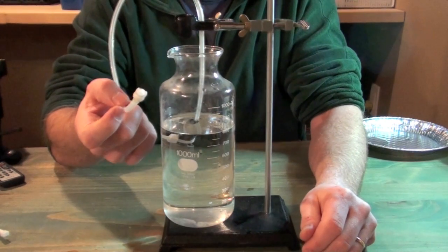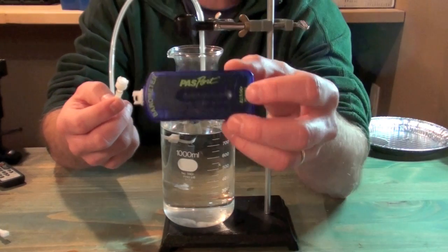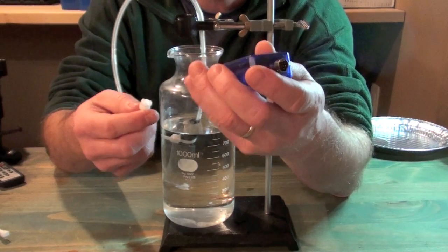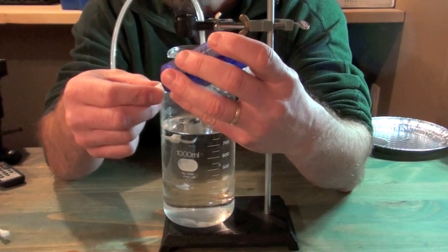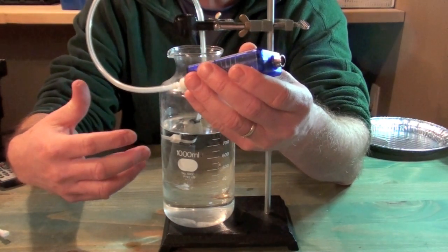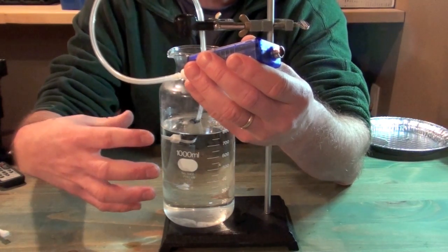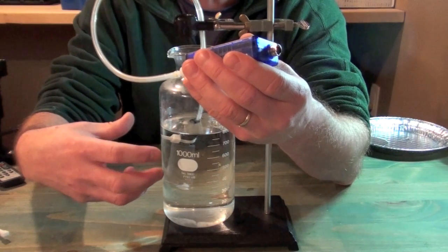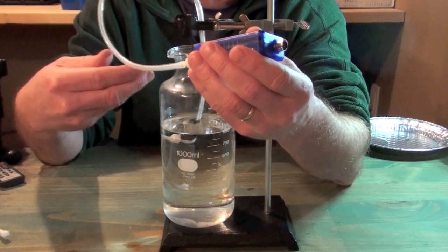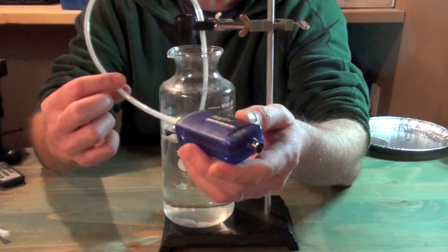So my free end here with the tubing, I'm going to attach to a pressure sensor. So this is a Pasco's barometer. It's exactly the same as Pasco's low pressure sensor. So it will do the job of sensing the pressure change as we have our osmotic gradient having water move into the tubing. And what that'll do is increase the pressure inside the bag, and that'll force water up through the tube. And when that water is pushed up through the tube, it will compress the air inside the tube. So we should be able to get a pressure reading from that.